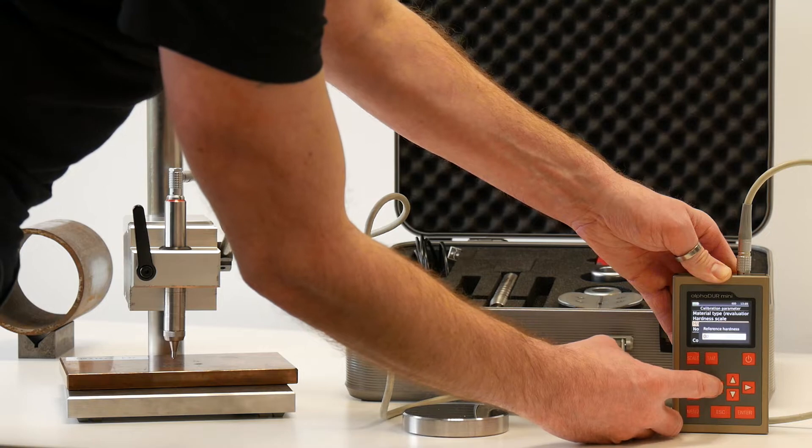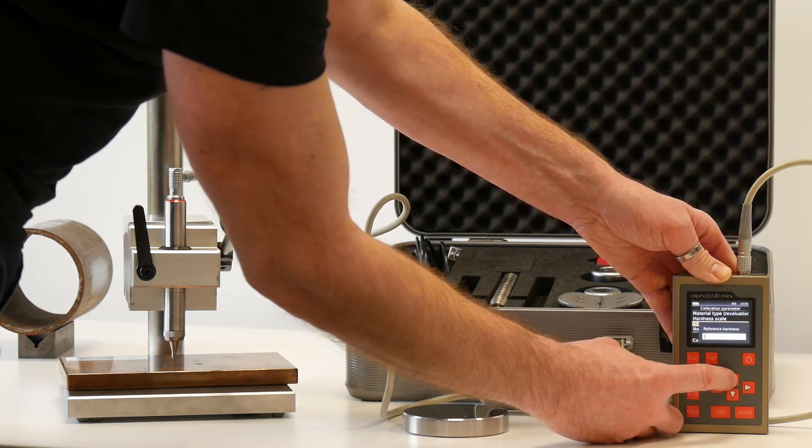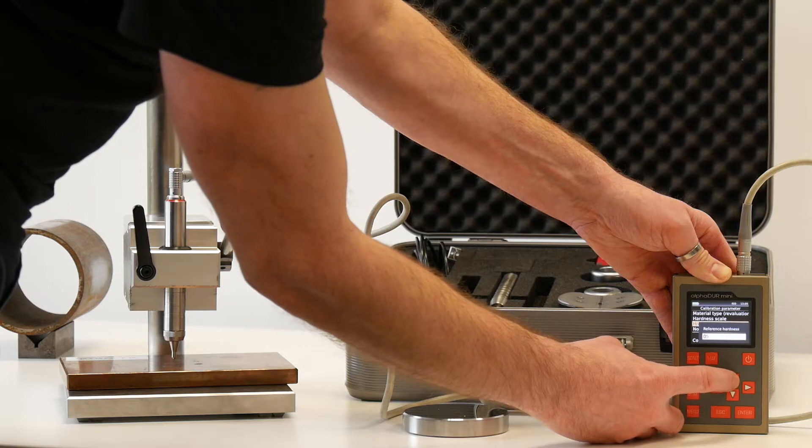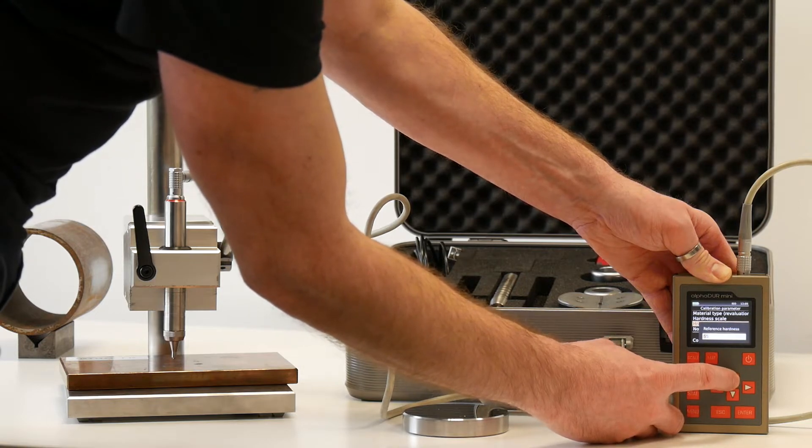We need to enter the hardness of our reference sample, which is 85 Vickers.